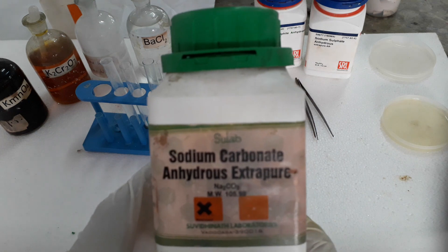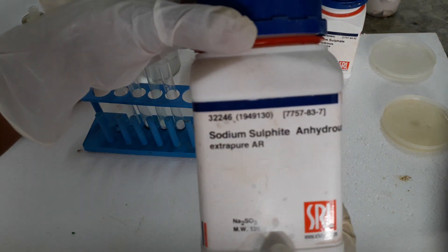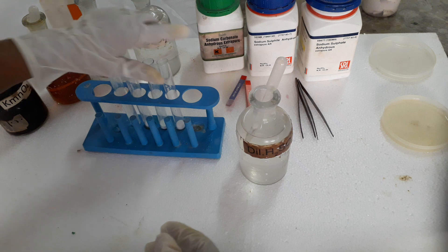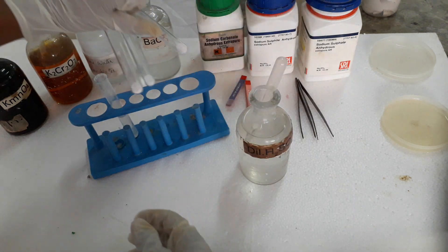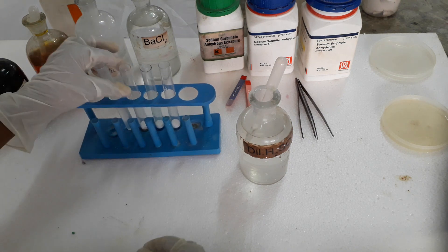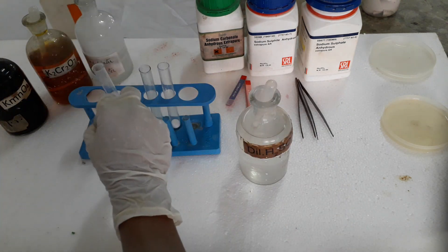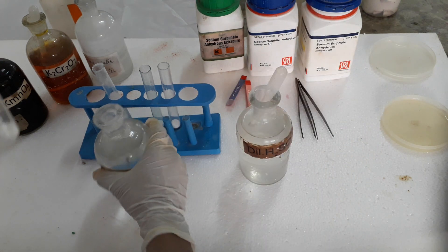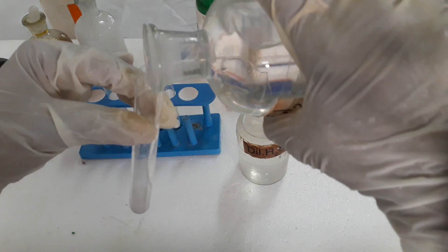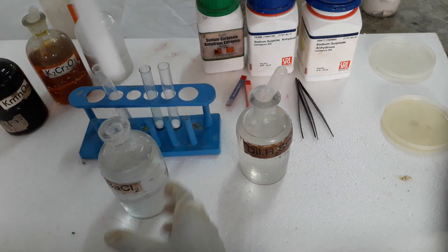First we will be doing detection of three anions. That is carbonate — for that I have taken sodium carbonate. Next is sodium sulphite for SO₃²⁻ sulphite, and for sulphate I have taken Na₂SO₄. All three salts I have already taken in these three test tubes. For detection of carbonate anion, we first add barium chloride solution. On adding BaCl₂ to sodium carbonate, we get barium carbonate — a white precipitate.